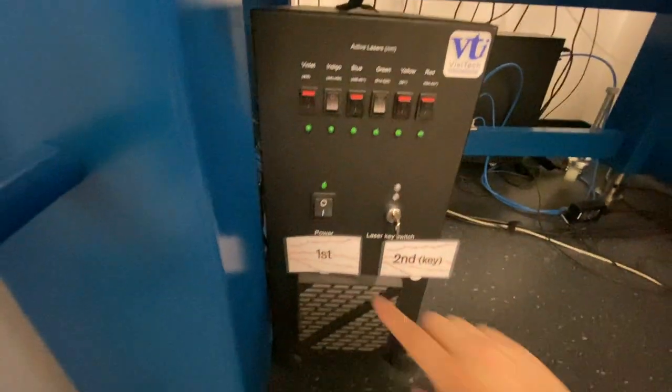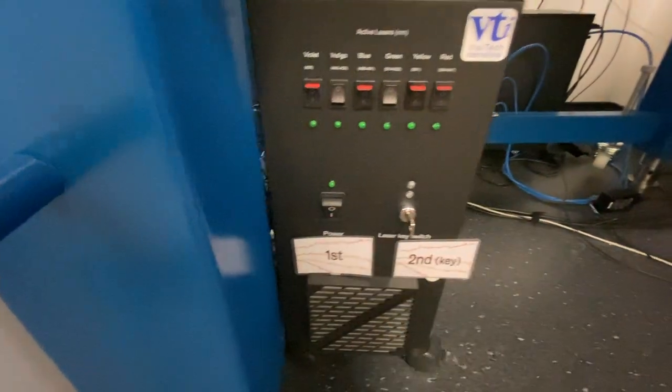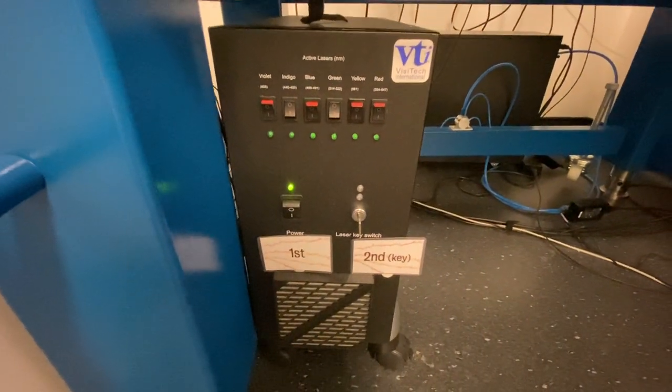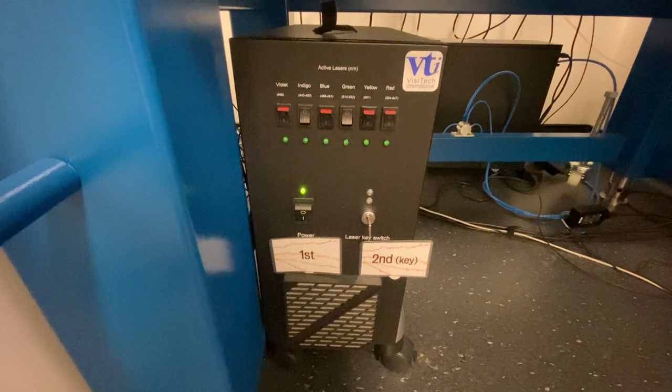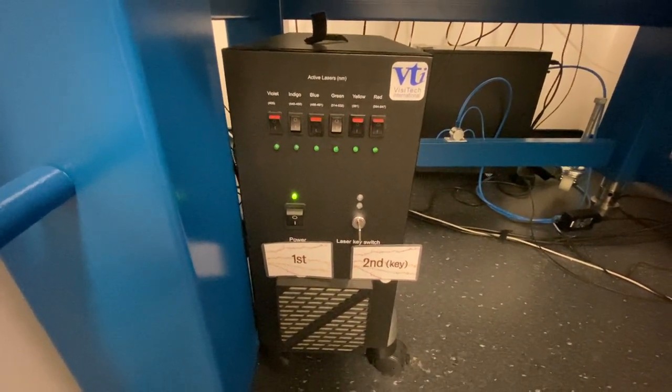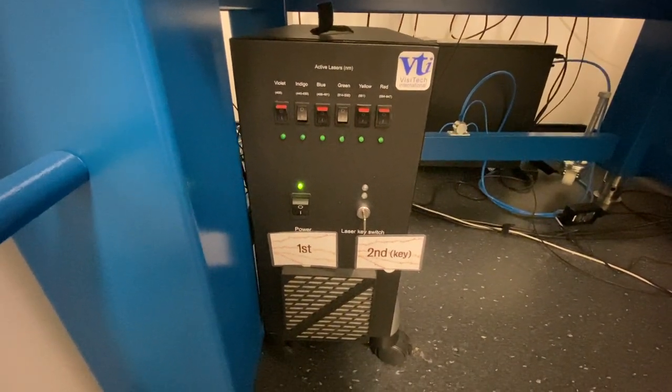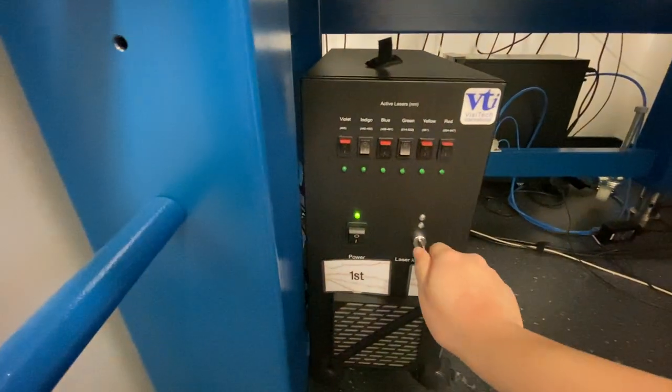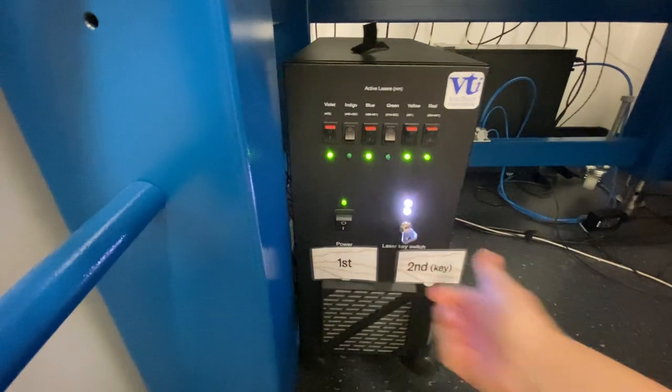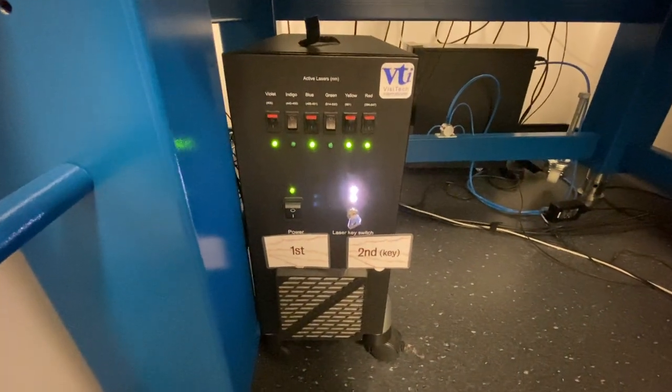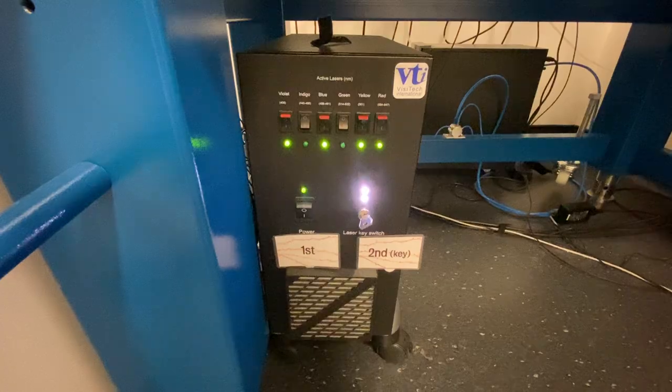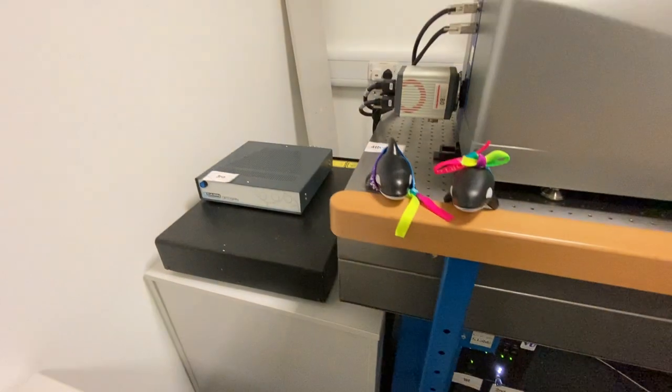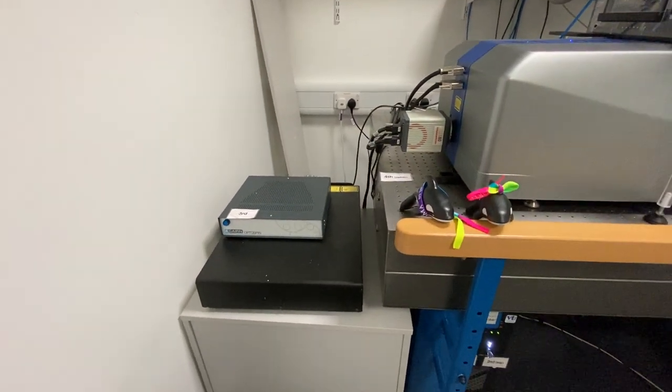So first, you want to wait for five seconds before turning the second key. And now you want to wait for 10 seconds before switching on the third button.